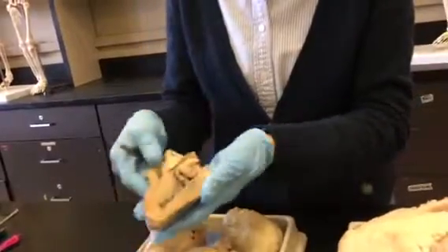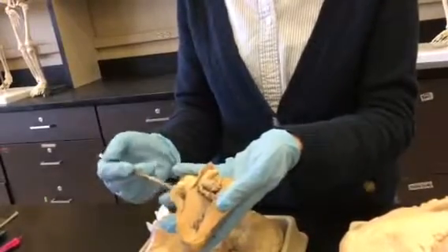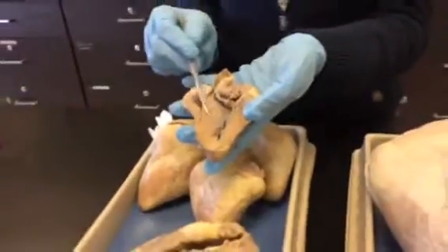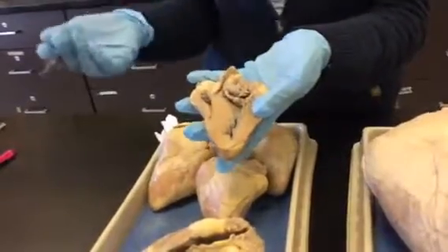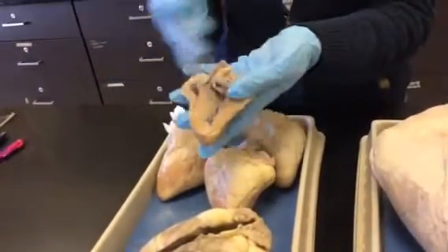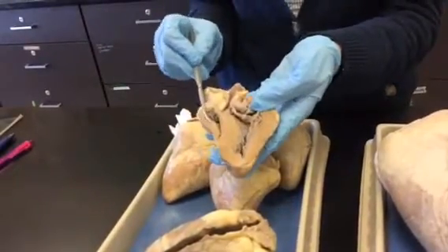Let's look at some internal anatomy. Here's half a heart. I've cut it so that we can see this is the right ventricle and this is the left ventricle. First thing you can see is that there's much less muscle on the right compared to the left. If they put pins in here, you're just going to say myocardium, because you can't see the layers of tissue at all — it all looks alike.